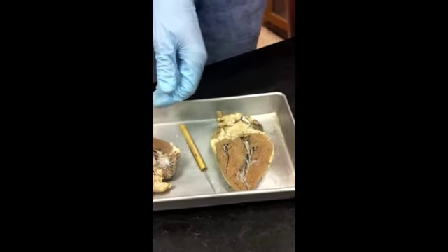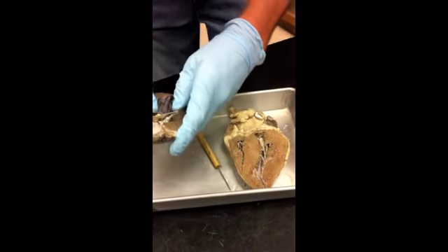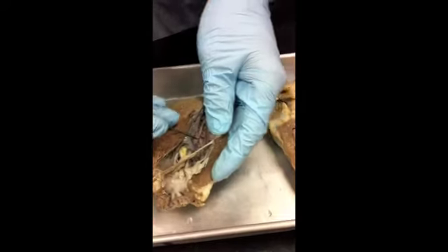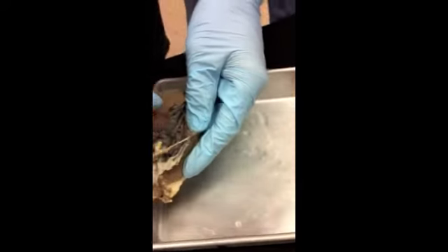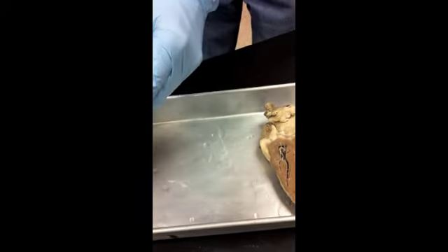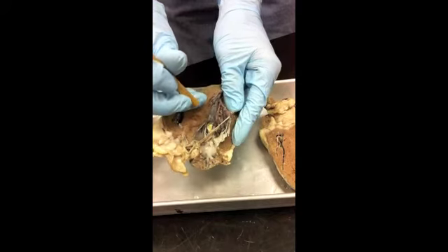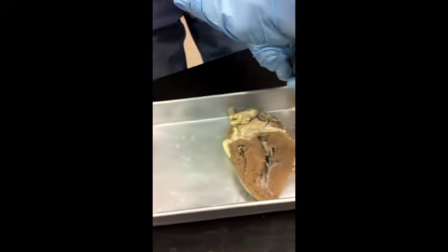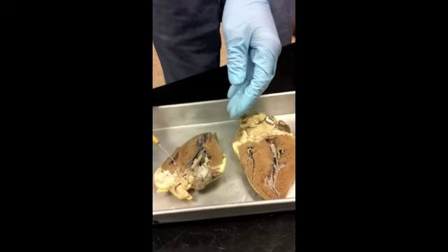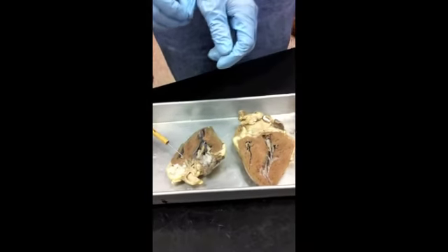So can we see the trabeculae there? Trabeculae? Oh, yeah. Do you see all this? Hold on. Yeah, good, thanks for reminding me. All this stuff in there is trabeculae. That's a papillary muscle that all these chordae tendineae are attaching to, but all the rest of this stuff almost looks like a spider web inside there, a spider web of muscle. That's trabeculae, all that stuff. So I think that'll be a good bit of stuff to identify on the sheep heart. Everything else we'll leave to the model.